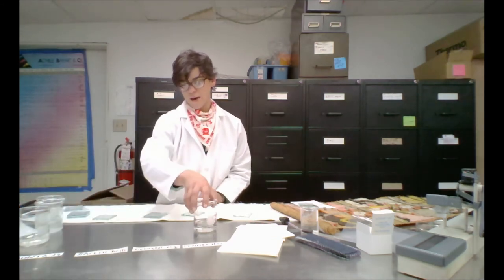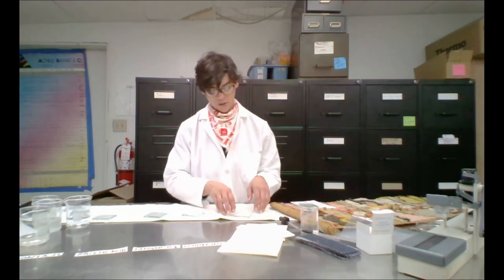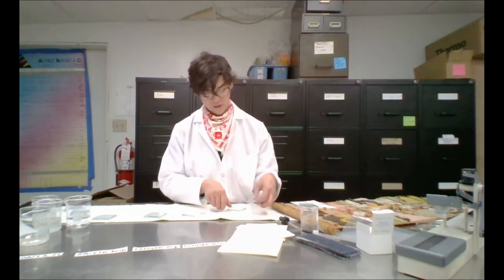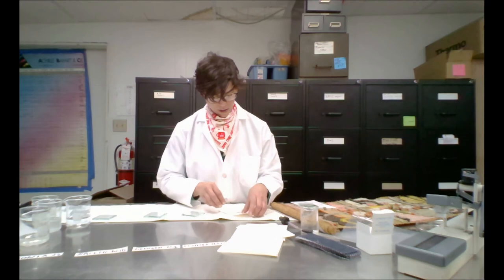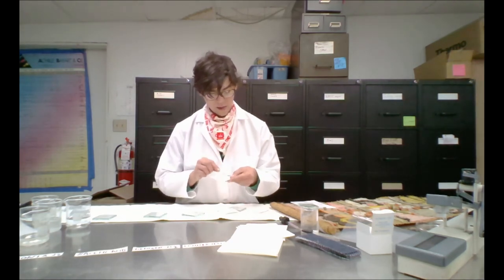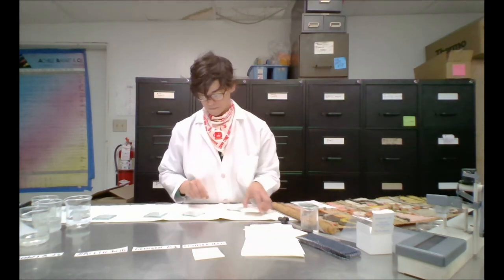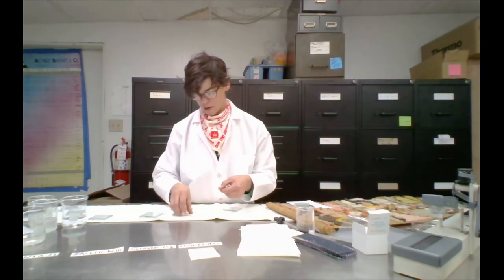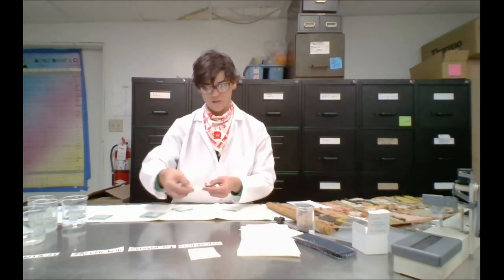So now everything is ready for us to see what happened. And first, let's check out our waters. Here's water, and there's no color transfer there. Here's another water, no color transfer there. Here's water.